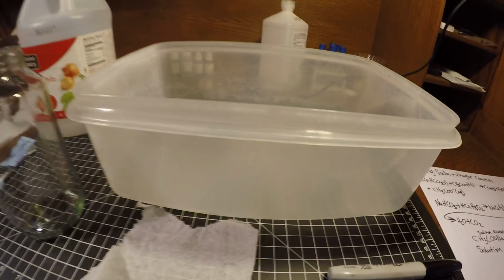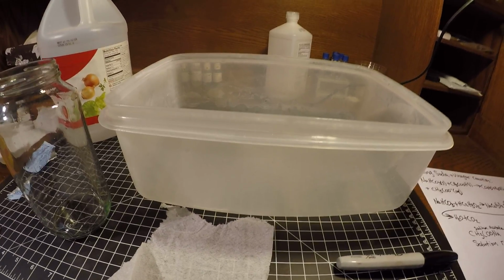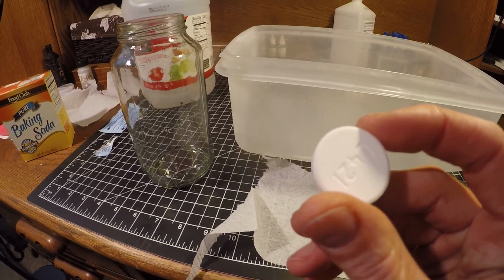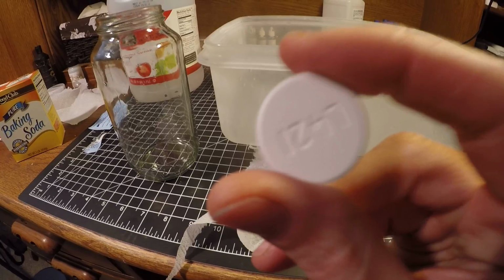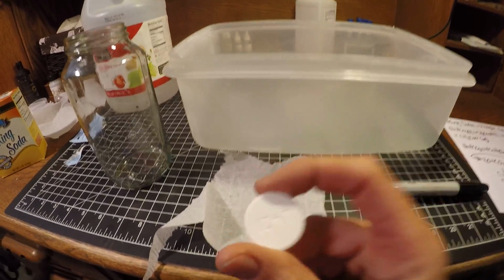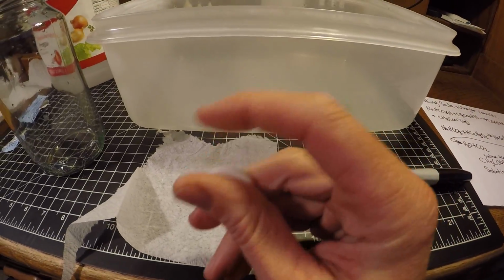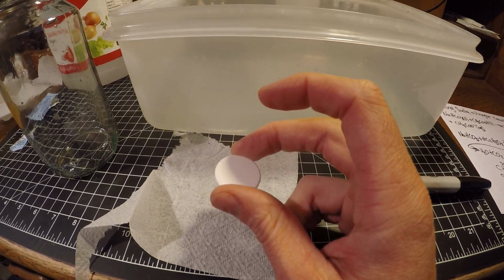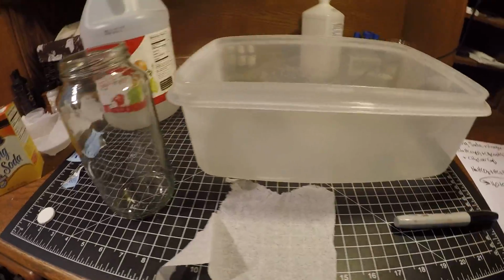So having the sodium bicarb placed directly into the liquid state of our acid, the reaction that we would have seen with our original Alka-Seltzer is going to occur a lot quicker, because the Alka-Seltzer took time to dissolve in the water, and as it dissolves in the water, the molecules are freed and allowed to interact with each other. In this case, the reaction doesn't have that delay in dissolving, and the molecules are free to interact with each other at a much quicker rate.